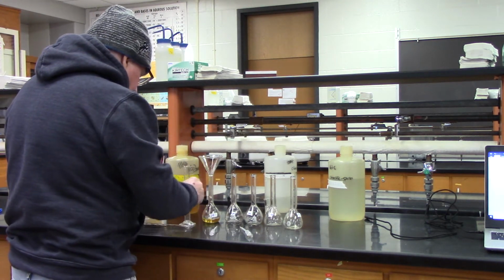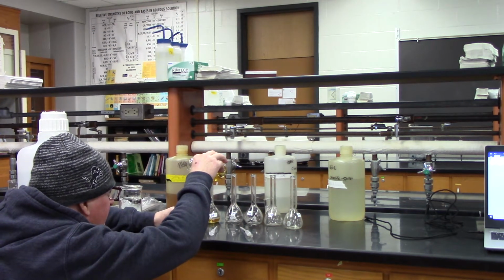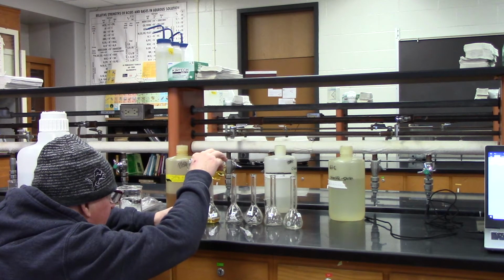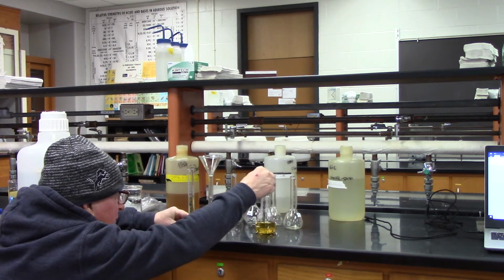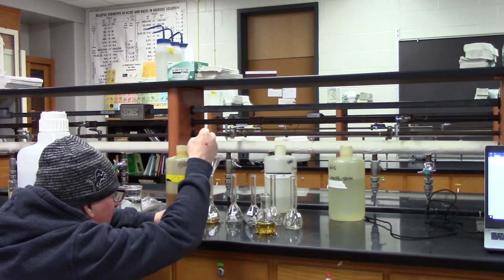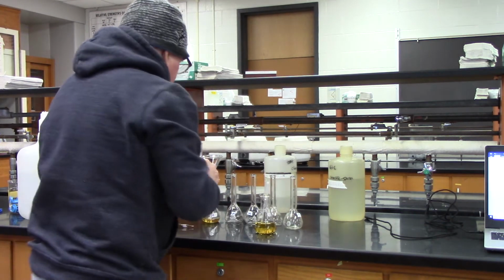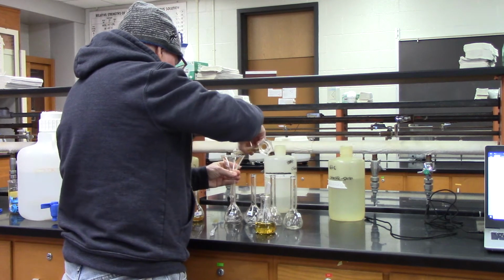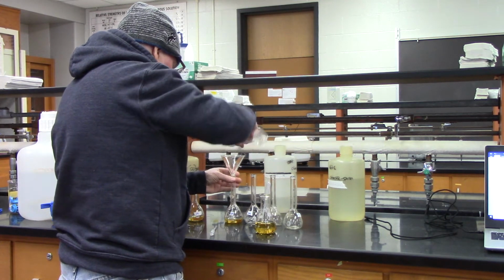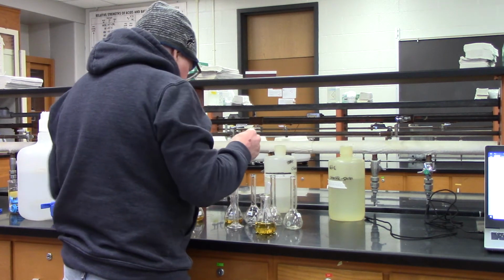Okay, so I'm going to do that with each one. Okay, and rinse it out.